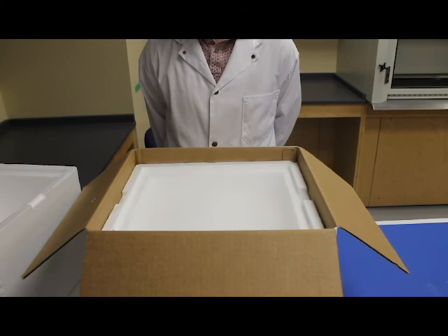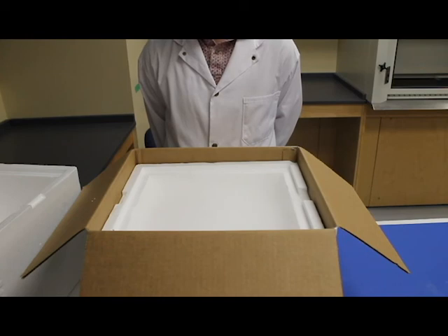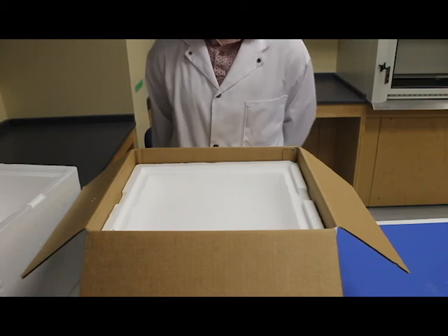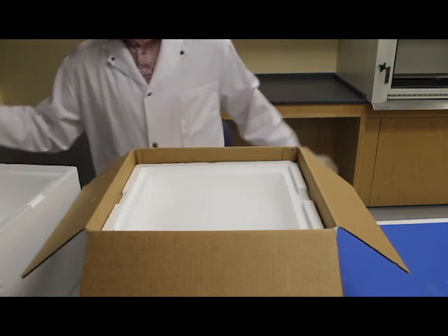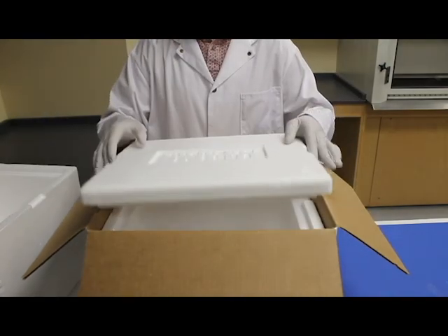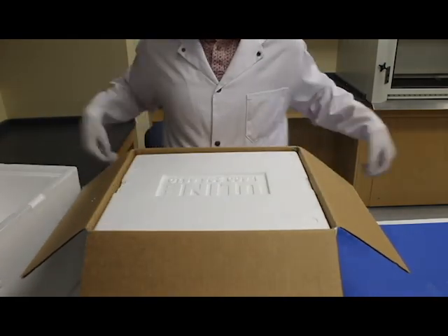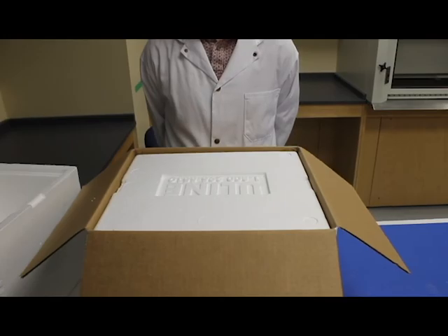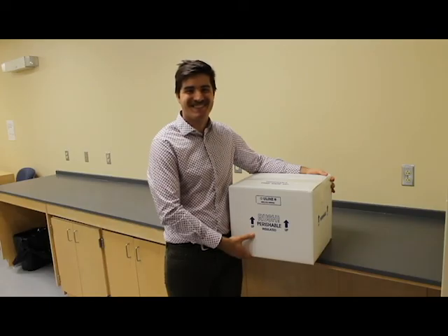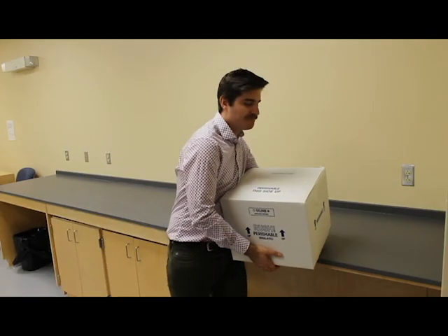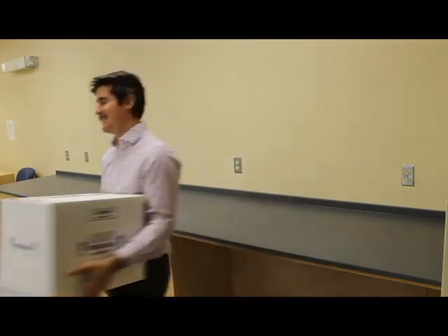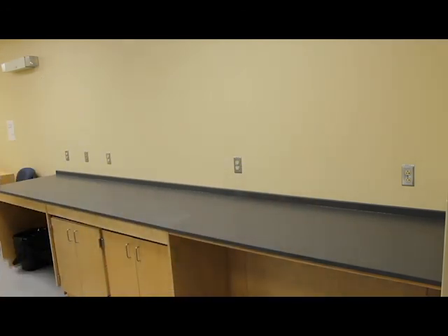Cover the lid and place the styrofoam container into the shipping box and seal the box for shipping. Add the prepaid courier label to the shipping box and deliver the box to the courier pickup location for overnight delivery.